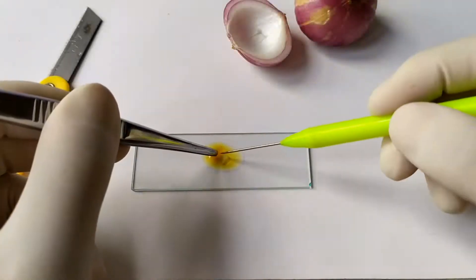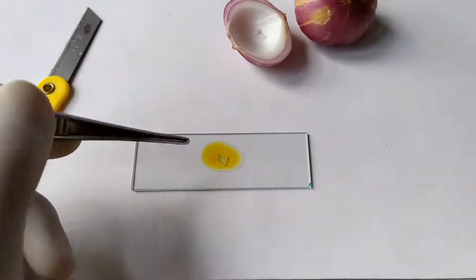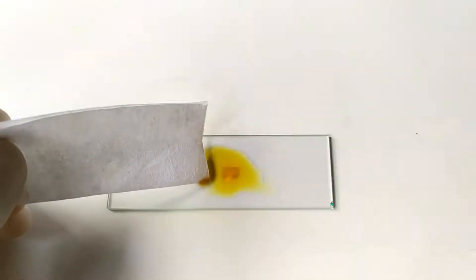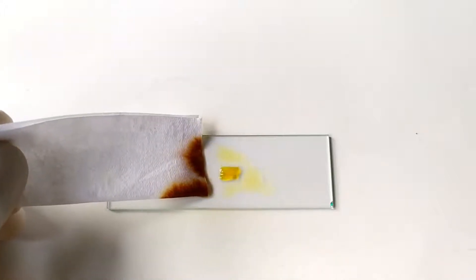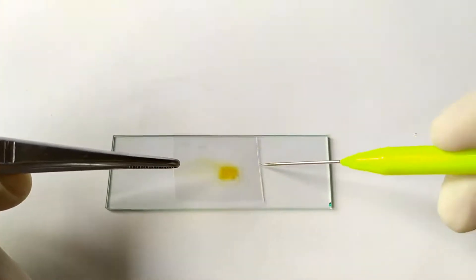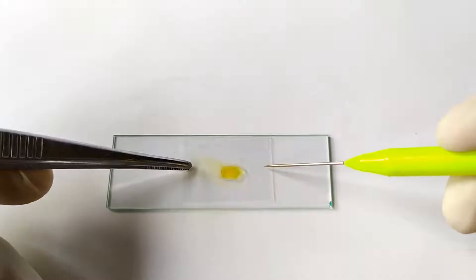Transfer the peel on a glass slide containing a drop of stain solution. Leave the peel in the stain for 2-3 minutes. Now blot out the stain from the peel and add a drop of glycerine or water to the peel. Gently lower a cover slip onto the peel making sure to avoid trapping any air bubbles.